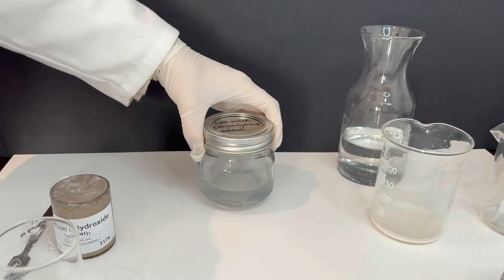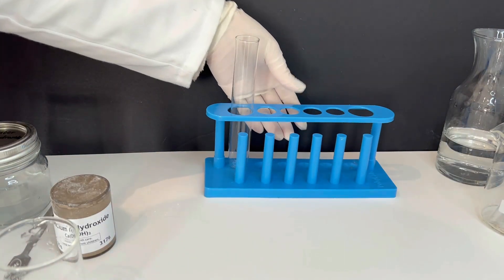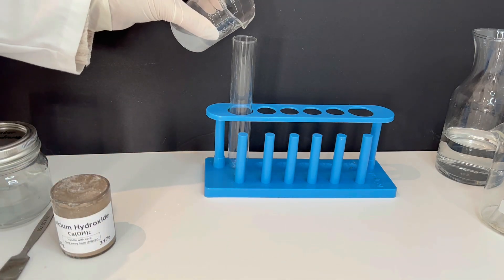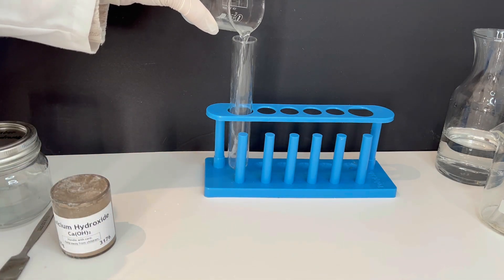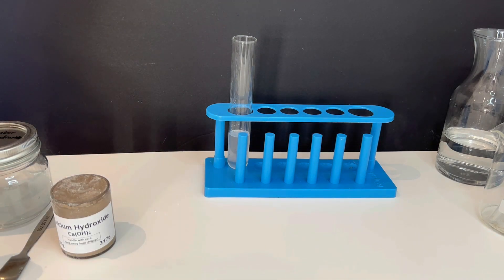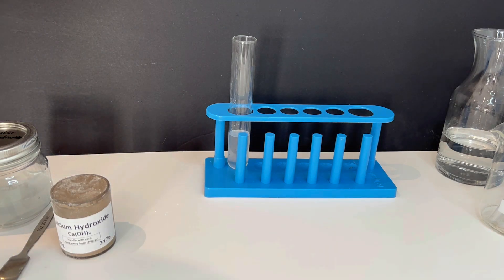Now to test your solution, blow gently through a straw into the lime water. If carbon dioxide is present in your breath, you'll see the solution turn smoky white. That's calcium carbonate forming, a classic positive test for carbon dioxide gas.